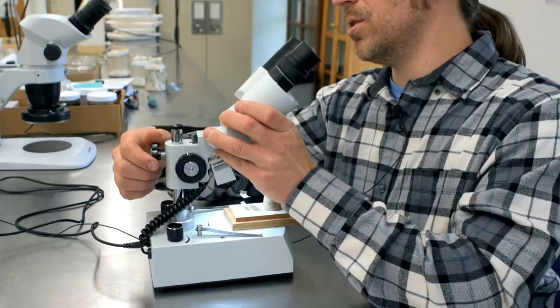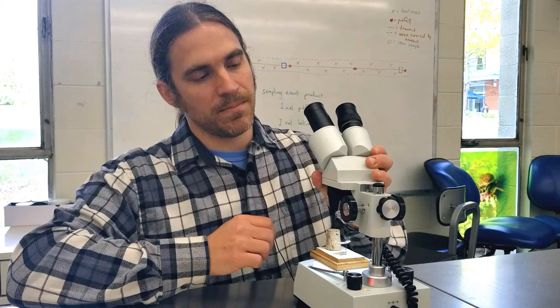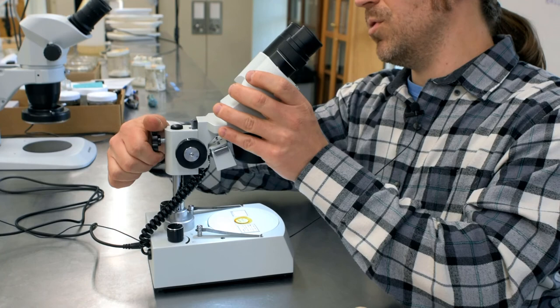In this model, depending on how high the insect or object you're looking at is, the coarse focus may not be enough to get it into focus. So you lower or raise the entire head of the microscope. When you're looking at an insect on a pin, you generally want to have it at the topmost level, but if you're looking at a slide on the base, you'll want to lower the head and then use the coarse focus until it's in focus.